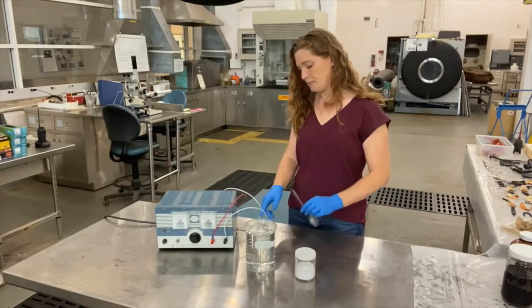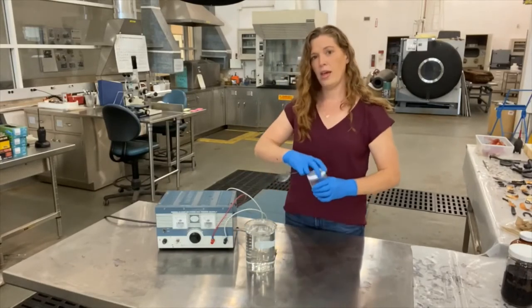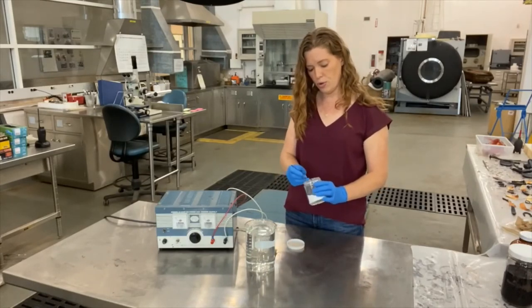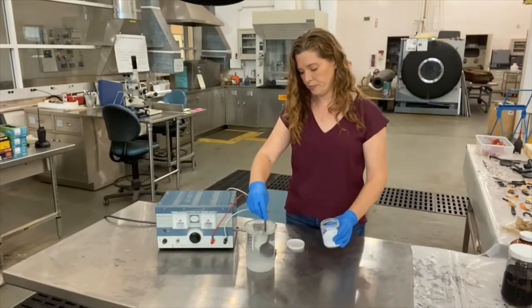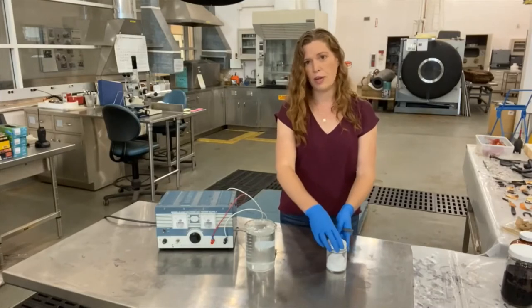We're going to start off with our solution of water and we're going to add an electrolyte to improve the conductivity of the solution.